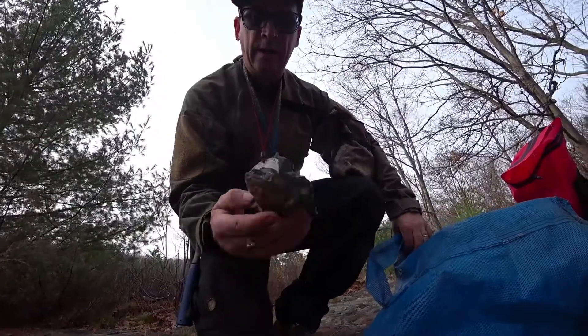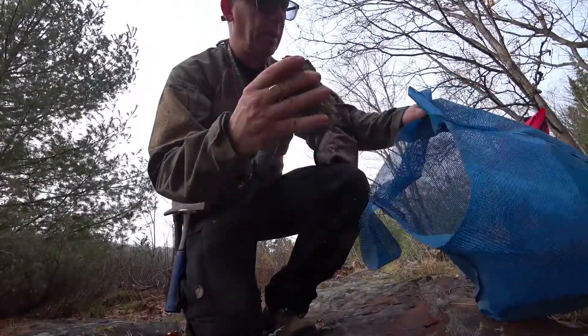Welcome back to Exploring Northern Ontario. If you remember, the last time I was out late in November, I collected some arsenopyrite samples from these old gold trenches. And now it's time to see if there's any free gold in these samples.